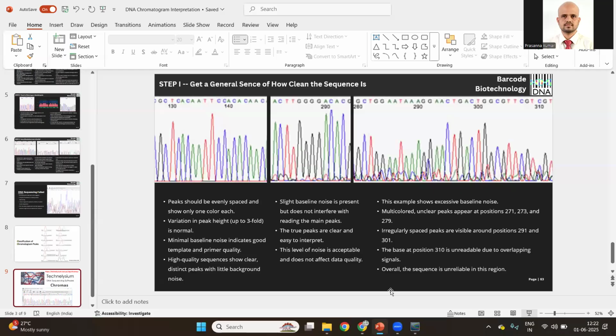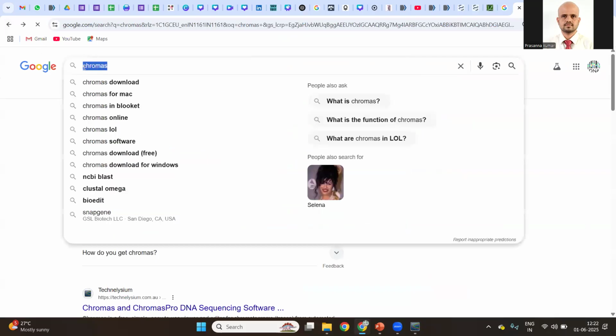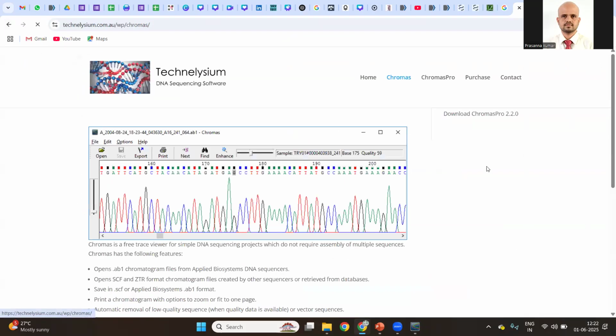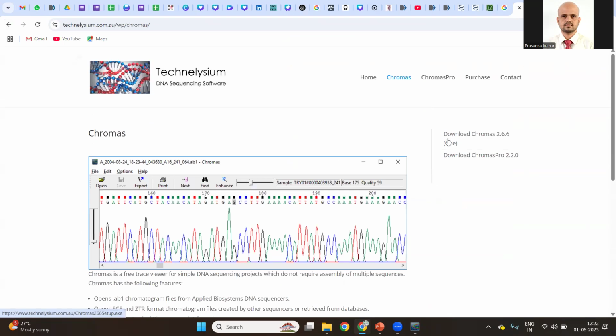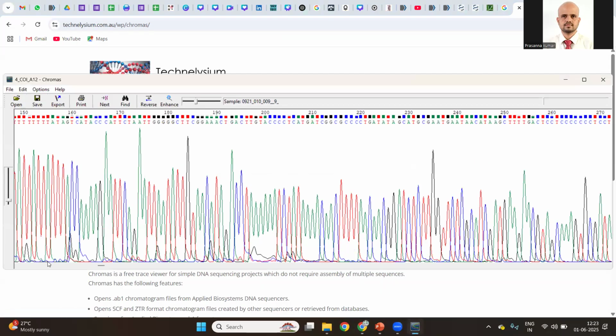I will tell you one more demonstration for when you are watching this. Go to Google, type Chromas, click the first option, and go here. There will be two options, Chromas and ChromasPro. You are supposed to download Chromas 2.66. Just click it. A 4.4 MB file will be downloaded. Go to the exe file, double click it, follow the instructions, give the permission and everything. It will get installed. Once installed, I will send you the files today.